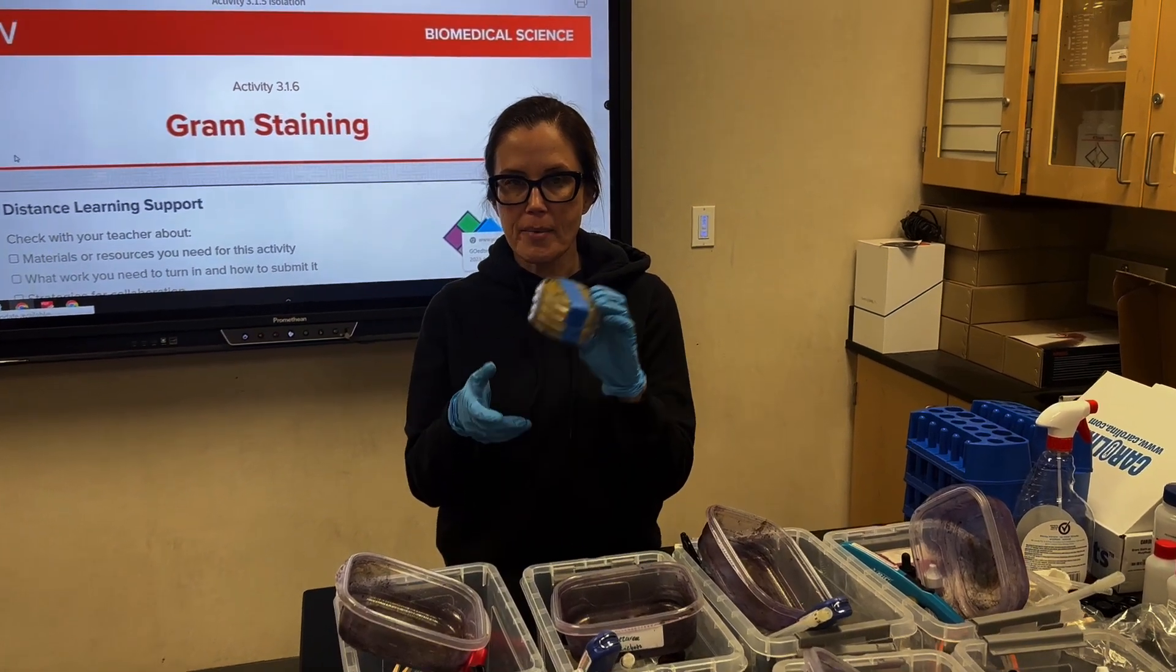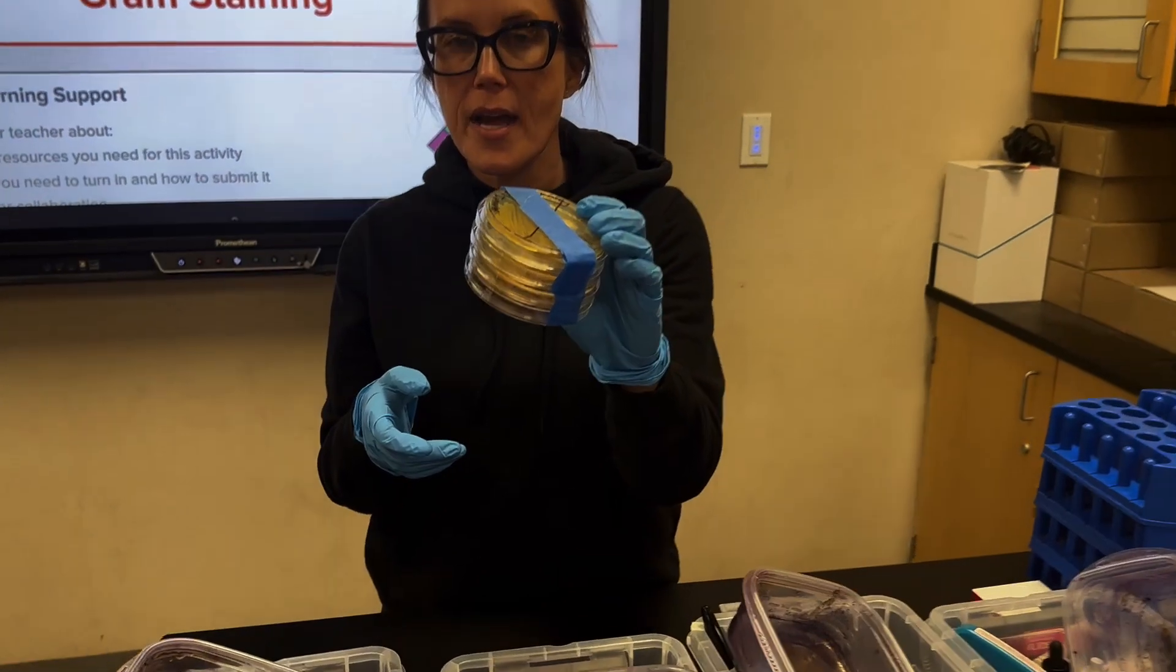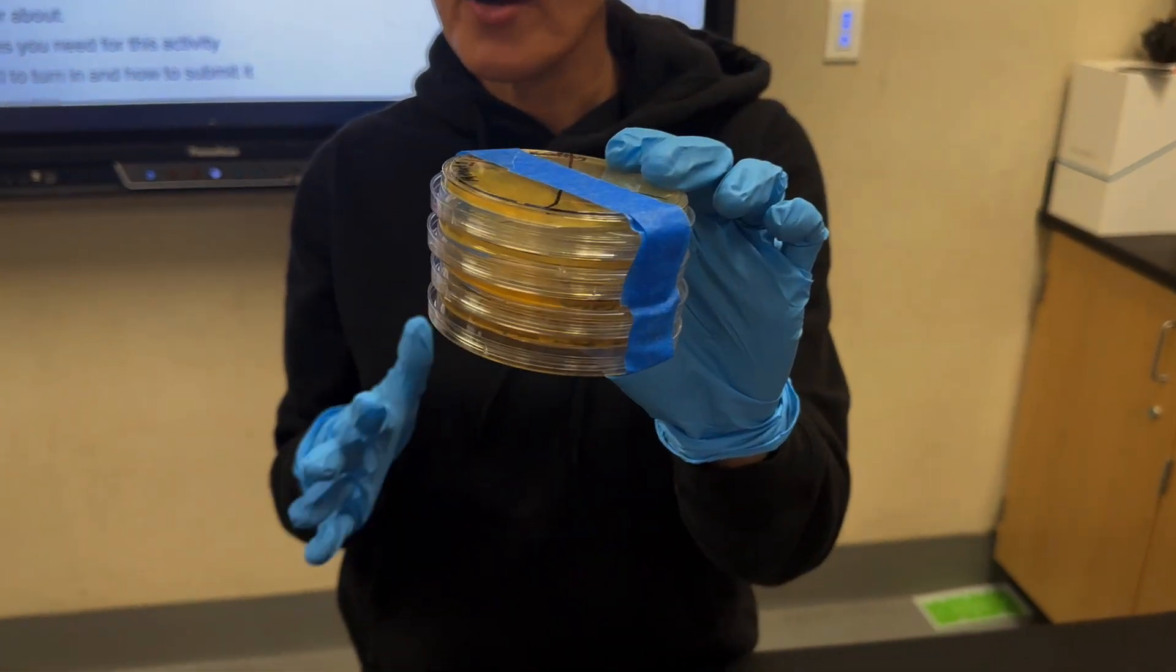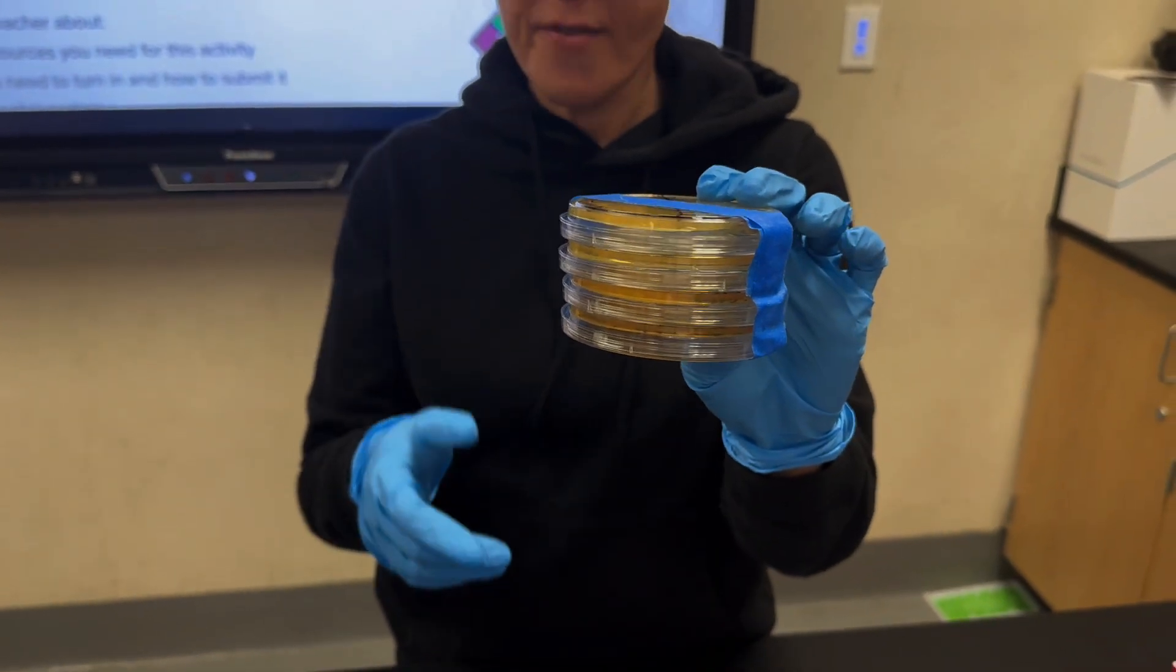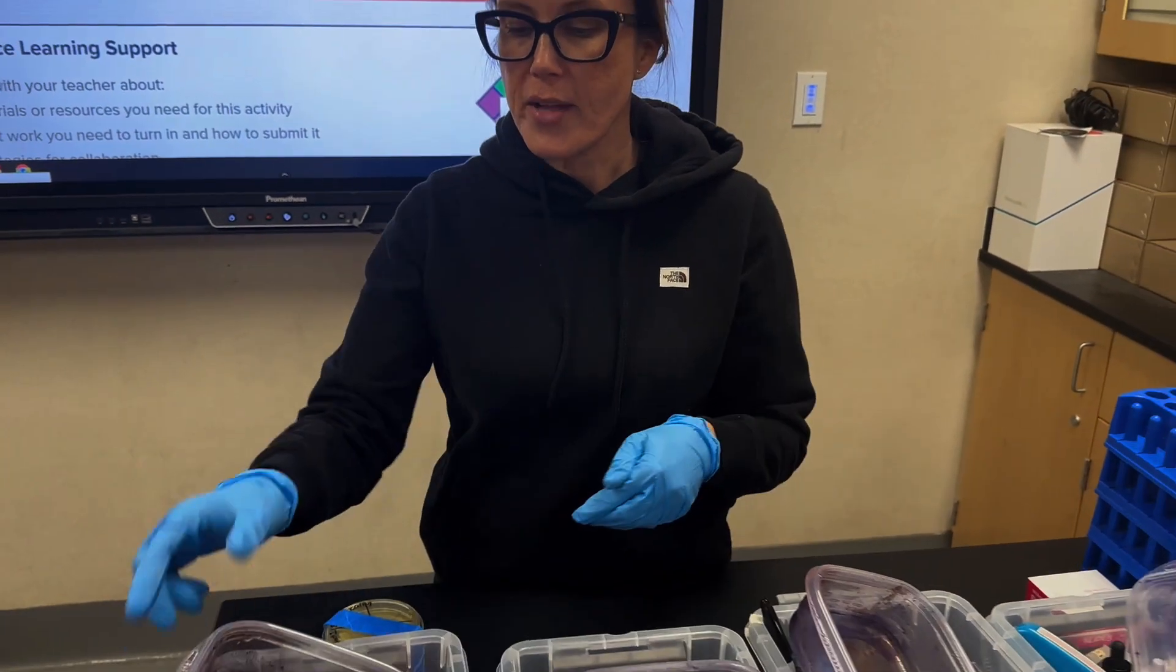You'll start with your students grabbing their plates from the incubator. Our plates have been in there for about four days before we started the Gram Staining Lab. I think three is probably enough. They'll need to have those at their lab area.